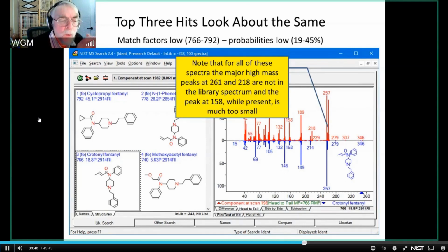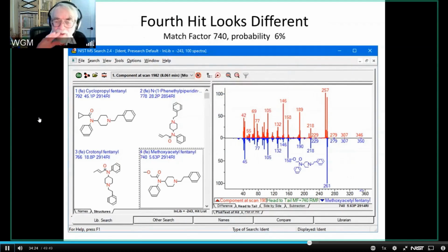You simply won't have a good match factor when you're missing a major high mass peak. You can miss low mass peaks and still get good match factors, but you can't miss a high mass peak. And the reason you can't is because high mass peaks are far, far more important for the identification of a compound than low mass peaks. And the algorithms that are used within NIST and within AMDIS emphasize the higher mass peaks more than the lower mass peaks. But when I go to the 4th one of these, I suddenly see a very different pattern.